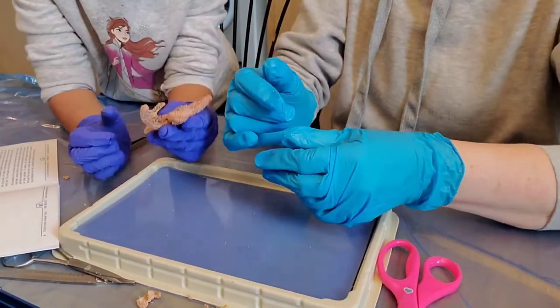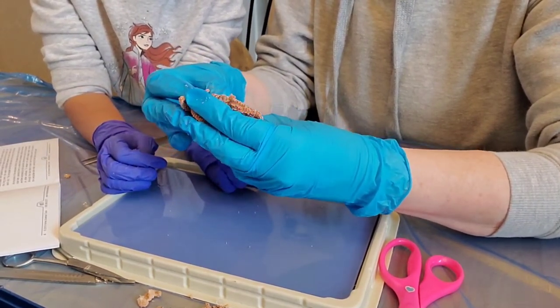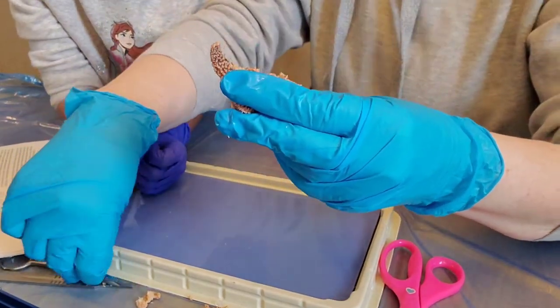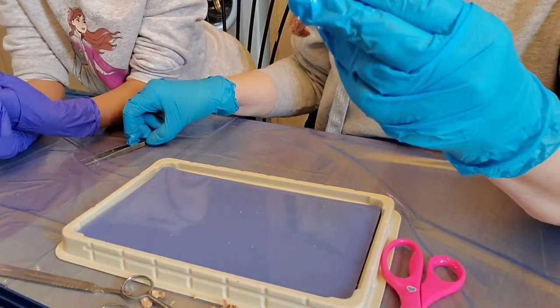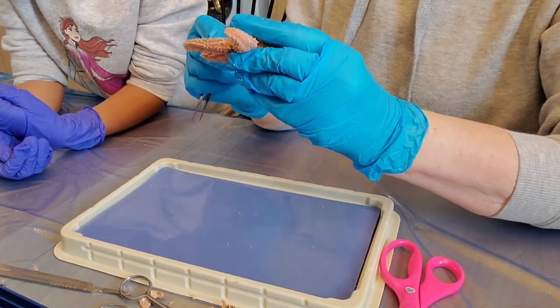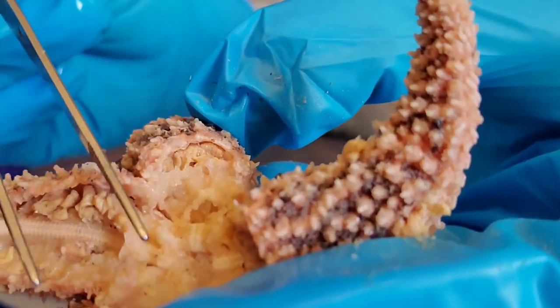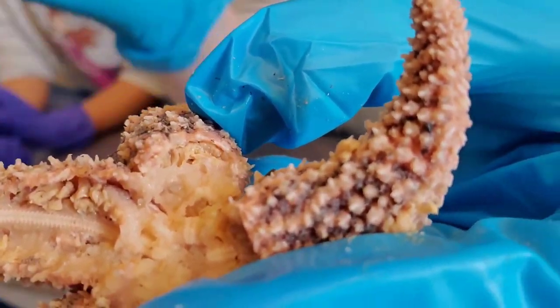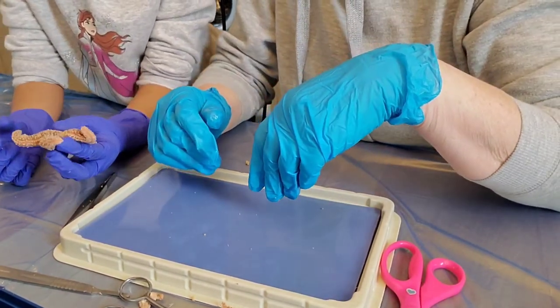Come over here so people can see what you're doing — I'm pressing the stomach. You can really see here — you can actually see the tubes. If you look closely you'll see the stone canal and the ring canal. Let me turn around so you can see a little better — it's hard because pictures are magnified in the book. All of those structures we were talking about, you can see that structure right there. I think we did pretty good — we found it!